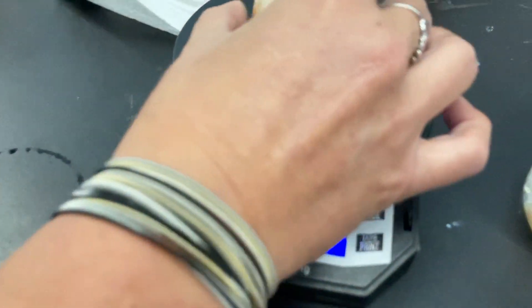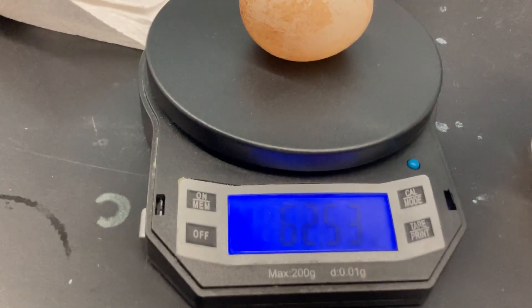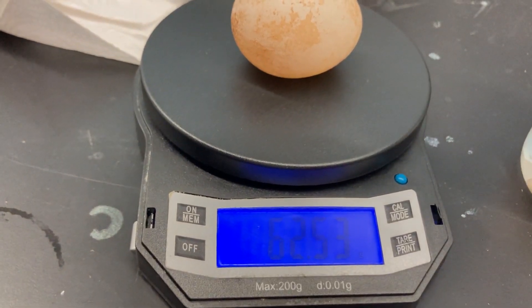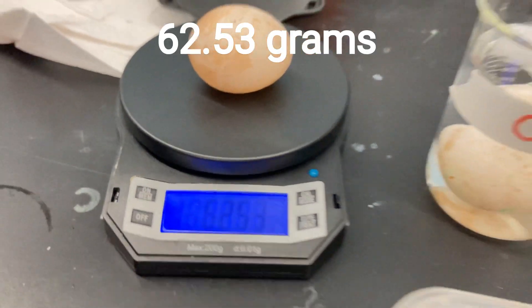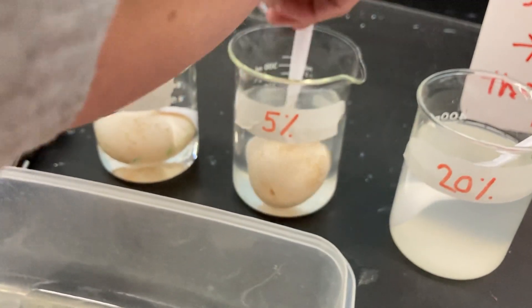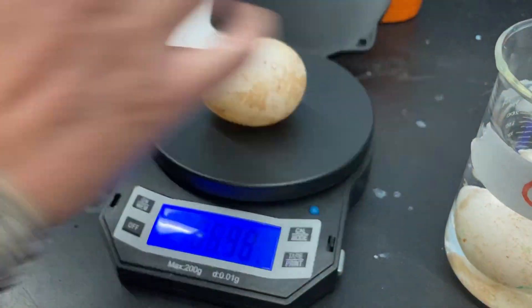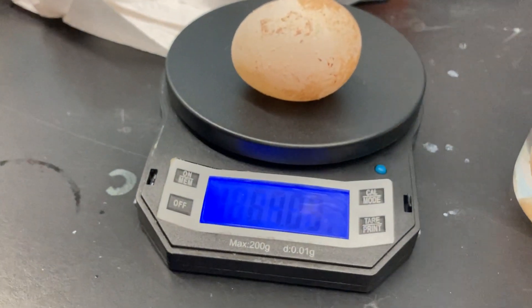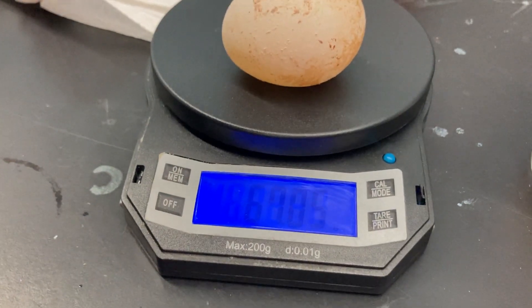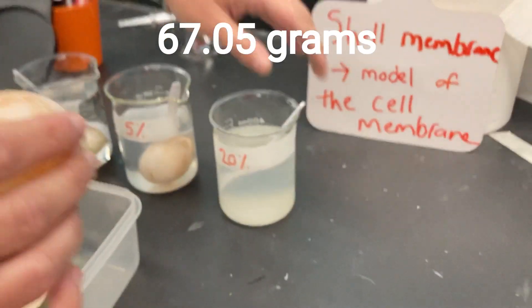My next egg — the starting mass is 62.53 grams, and that is going into our 5% salt solution. And then my last egg — that is 67.05 grams, and that will go into our 20% salt solution.